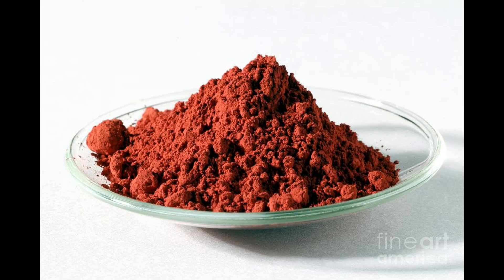Copper-1 oxide is a red solid used as a pigment and fungicide. Actually, I have no planned use for copper-1 oxide. I just want to try making some copper-1 compounds for fun.